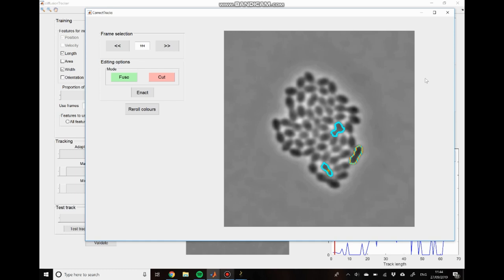And just before I finish this section off, I've just seen another example that I should probably point out. So you'll sometimes see these cases where you have this dashed cyan and orange outline. And what this is telling you is that this object, or sorry, this track, is only a single time point long, which means there's only a single object associated with it. And that object is both the start and the end of the track, which is why it's both colours.